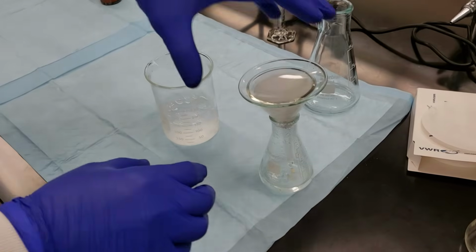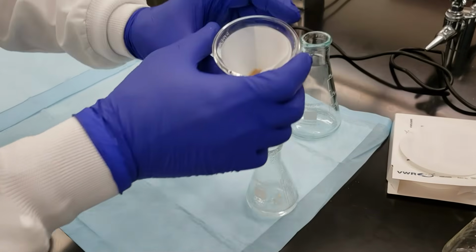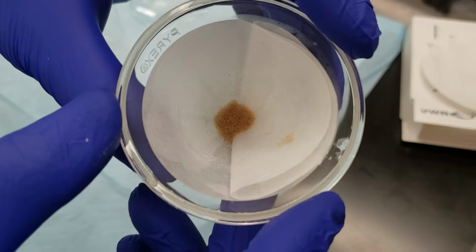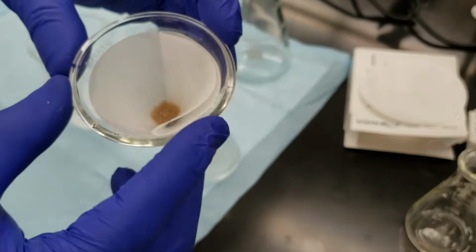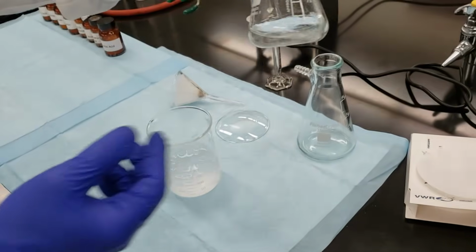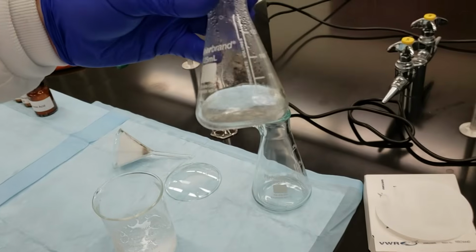So we've cooled our flask down. We're going to go ahead and take apart our filtration setup. We'll get one last shot of our sand that was captured in our gravity filtration. That's our impurity that's now been removed. We'll set that aside. We have our water and pure compound now in the catch flask.